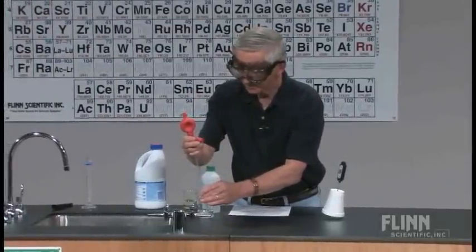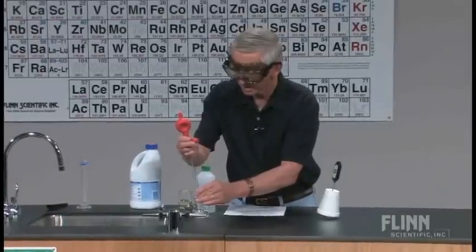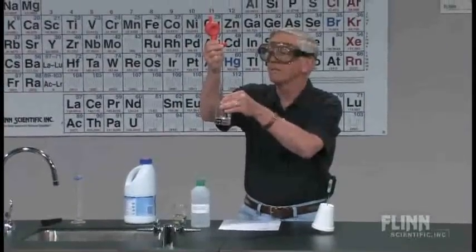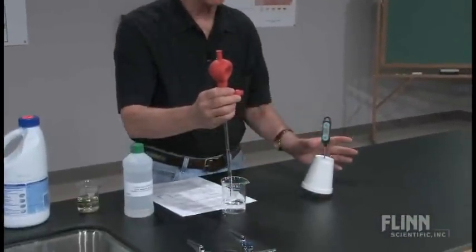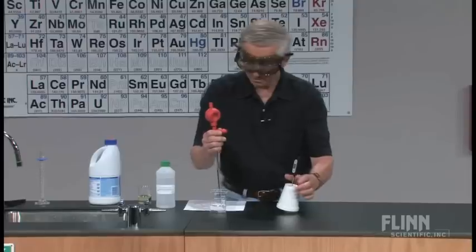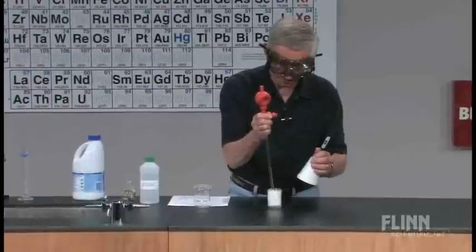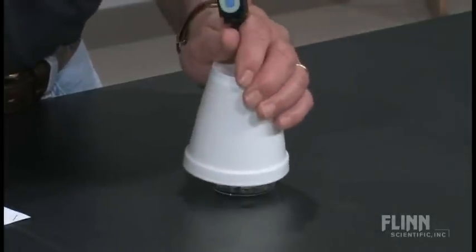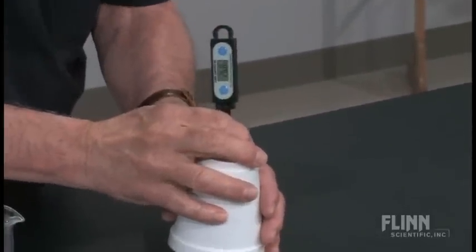This is a 5 milliliter TD pipette. What I'll do is bring the volume level up to 1 milliliter, then just drain it all. I'm going to lift the cover off, inject the acetone, and put the lid back on. Swirl it a little bit to get mixing.